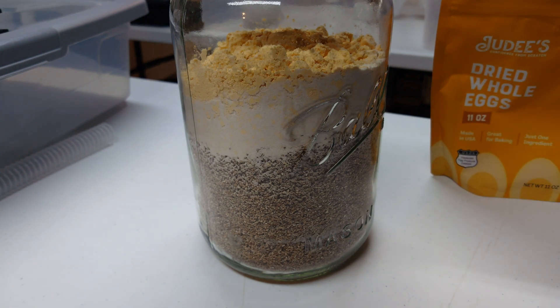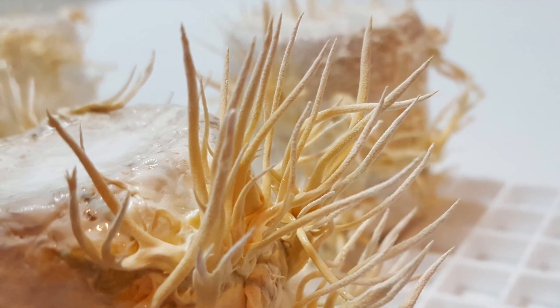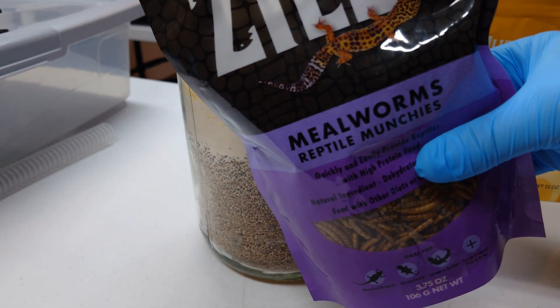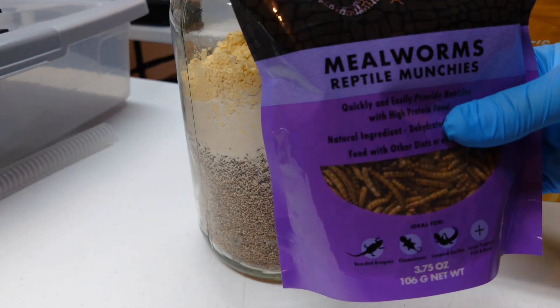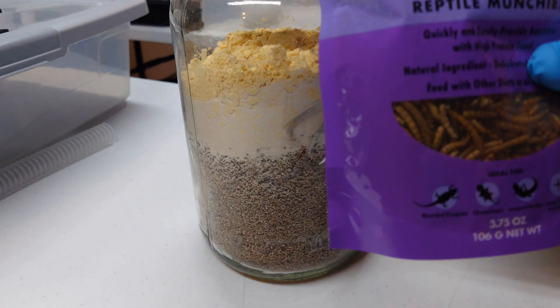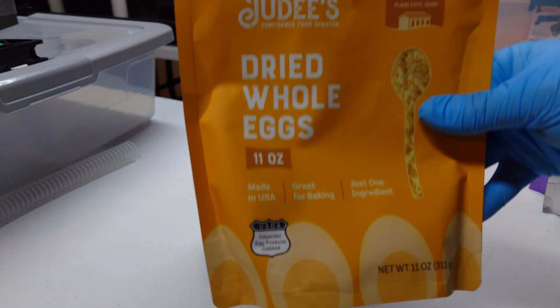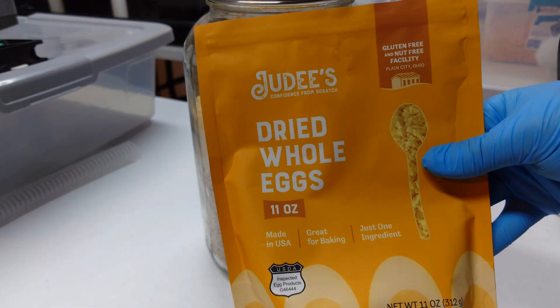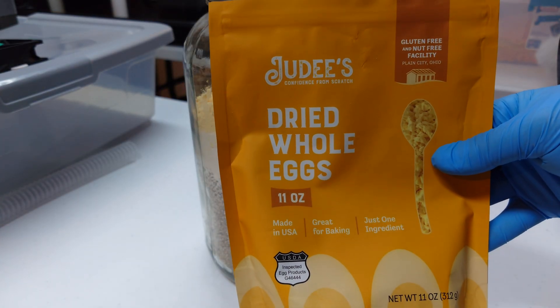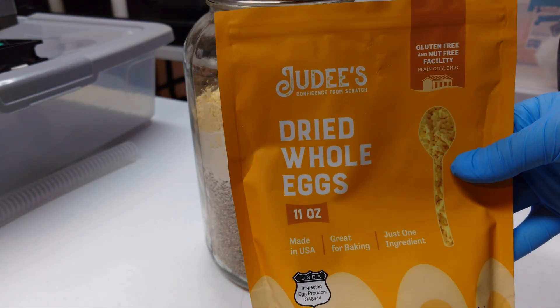Then I was playing with a couple different species of cordyceps. I was trying out some Isaria tenuipes too, which is like a little white snowflake cordyceps. I did some trials with mealworms — you can buy these at the pet store, ground them up, added them to the brown rice flour vermiculite mixture. The Isaria tenuipes liked it, but the cordyceps militaris really didn't. So I considered that a fail. What ended up being the real game changer was this right here — dried whole egg powder. You don't want egg yolk powder, you don't want egg white powder — you want the whole egg, dried whole egg powder. And that took it from zero to hero.